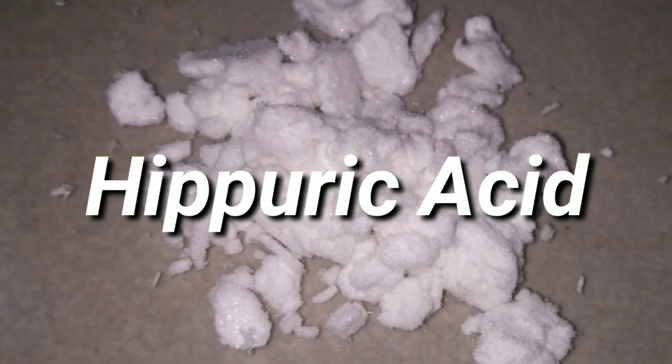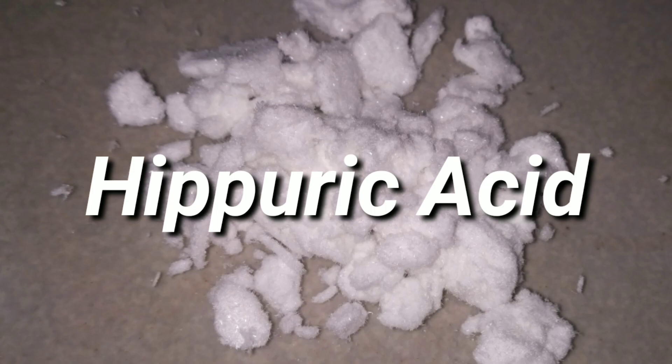Hello friends, in this video we will be synthesizing Hippuric Acid.